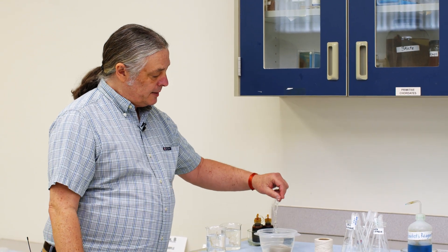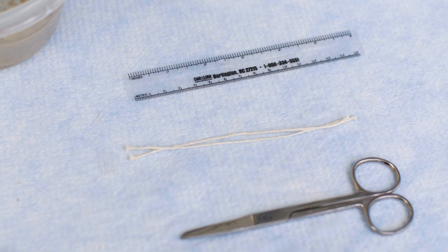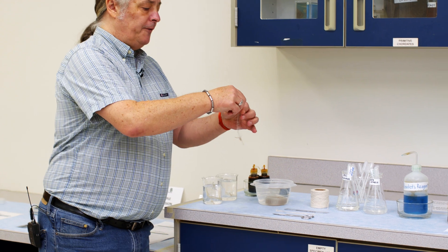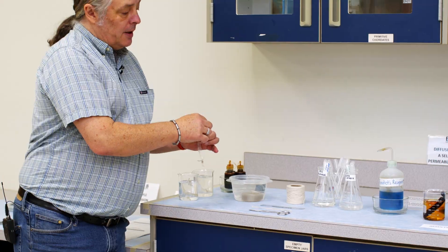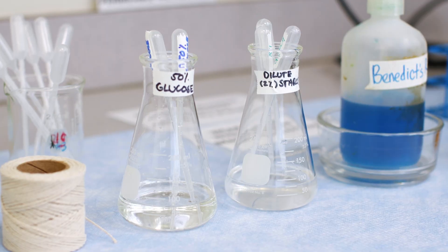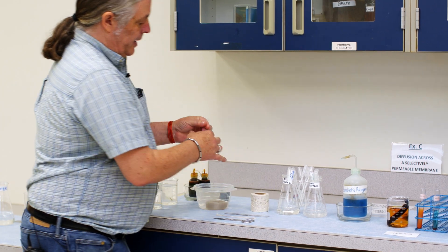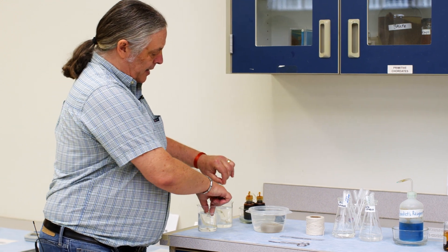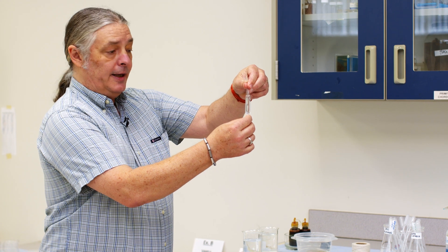What we're going to do in this experiment is take a piece of this tubing, tie off one end as you see here, and fill the tubing with a little bit of starch solution and glucose into the tube. Then we're going to tie the tube off at the top, making like a little water balloon with the solutions in it.